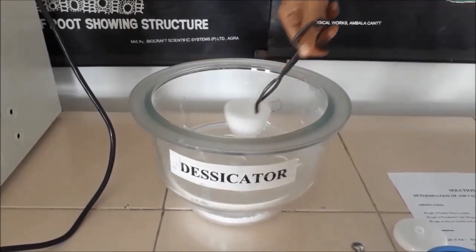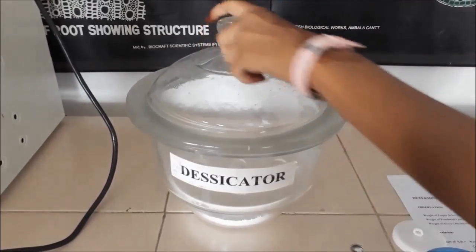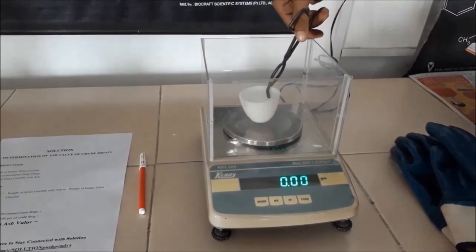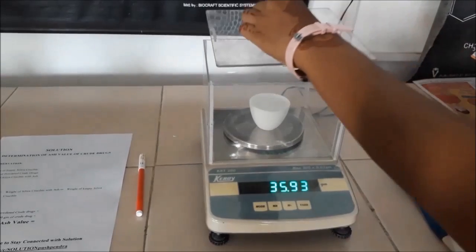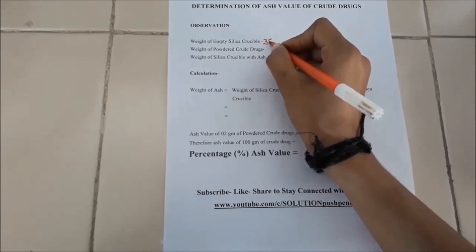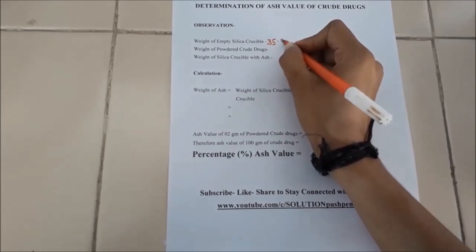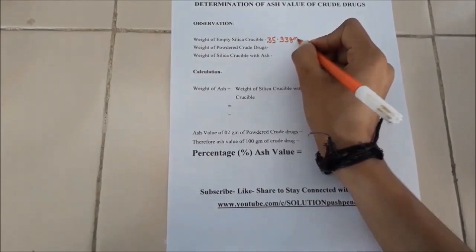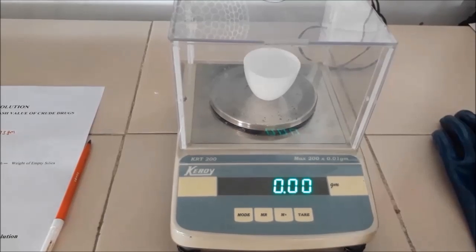After 30 minutes, weigh the empty silica crucible in the digital balance. Here the weight of the empty silica crucible is 35.93 grams. Record this weight into the record sheet as the weight of the empty silica crucible.